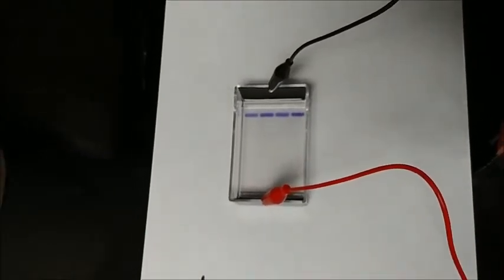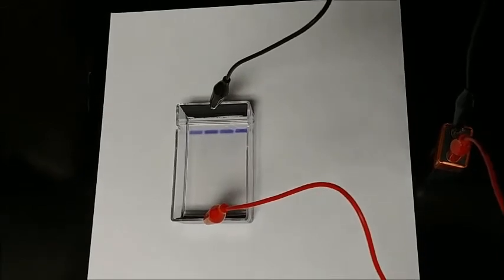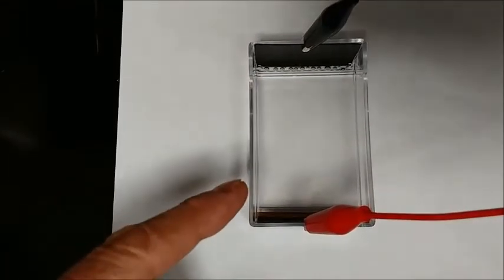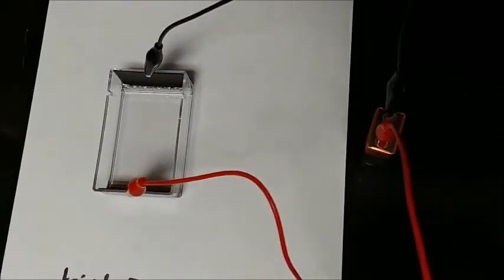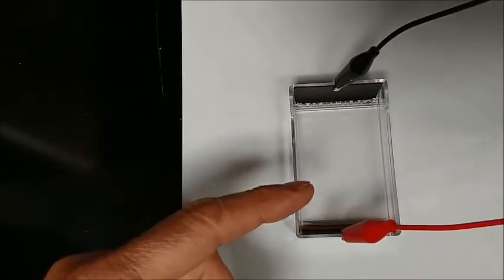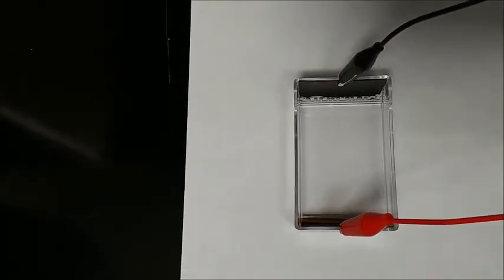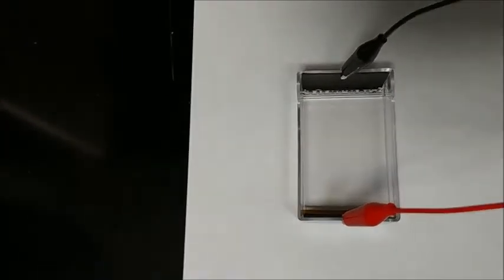I'm just running it off of a single battery for about 24 hours. We'll take a look every once in a while and see how it's coming along. The gel has been running for almost 10 to 12 hours on a single 9-volt battery. Earlier today I saw that the original dye was about midway, so I'm going to go ahead and put the final dye on it and rinse that several times and see if some of the banding will go ahead and show up.